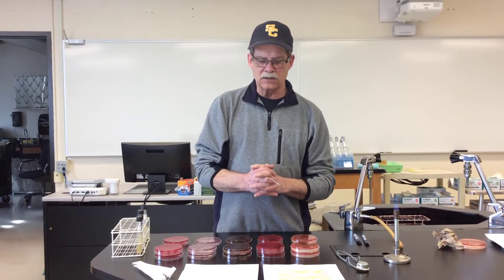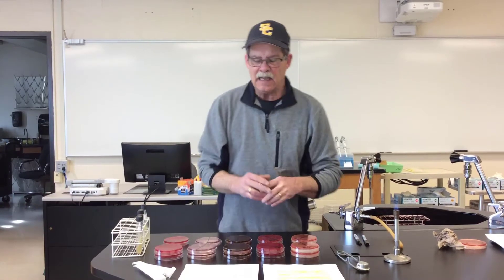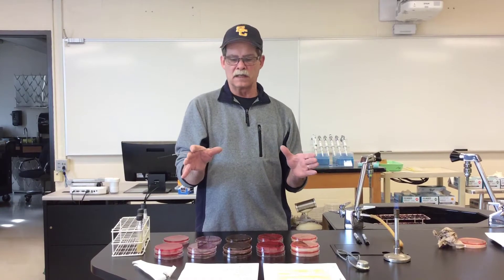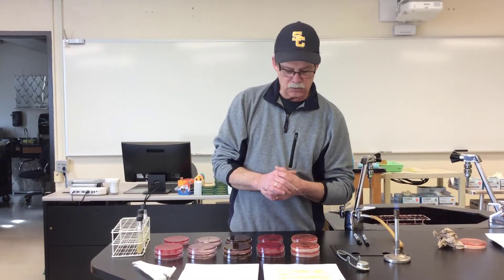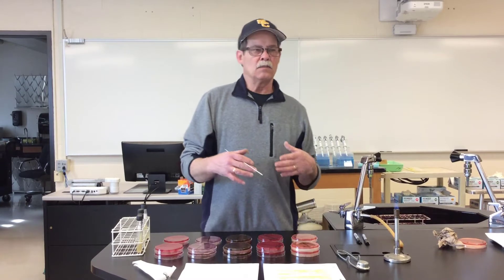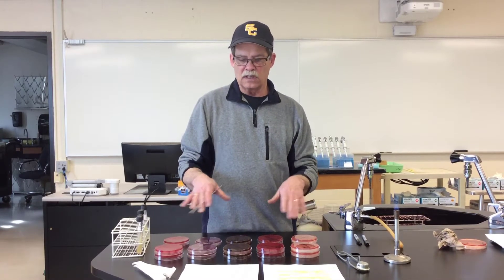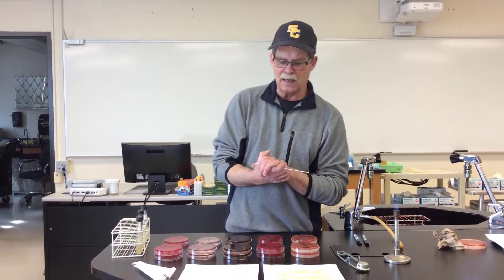What we can say in a nutshell about selective media is that it will suppress the growth of some bacteria, some organisms, while allowing the growth of others. Mannitol salt agar, MacConkey agar, and EMB — some of the ones we're using today — would all be examples of selective media.